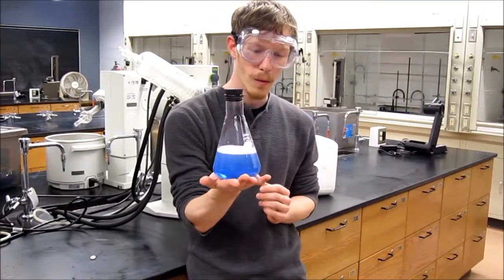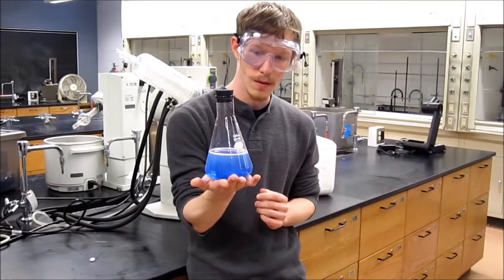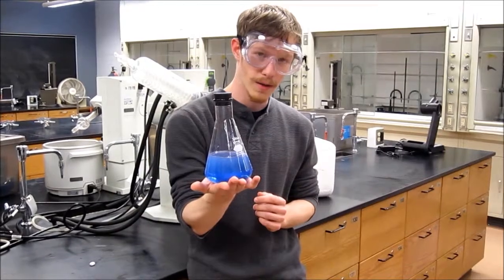And it'll sit there for a while, and it should start to turn back to clear. And I don't know how long it's going to take.